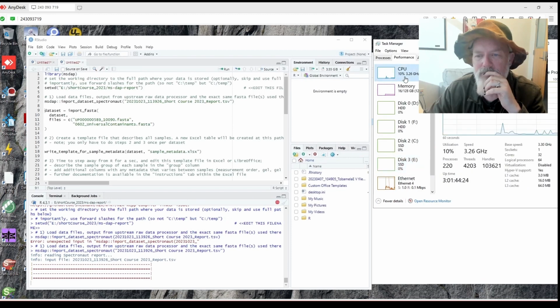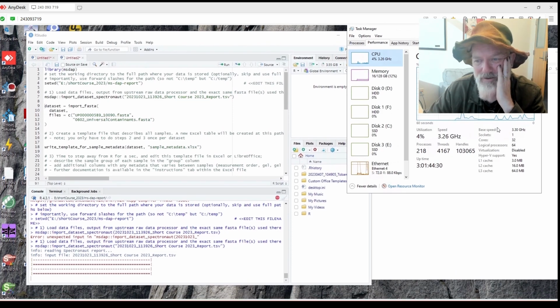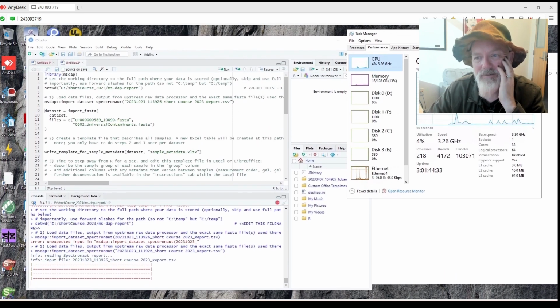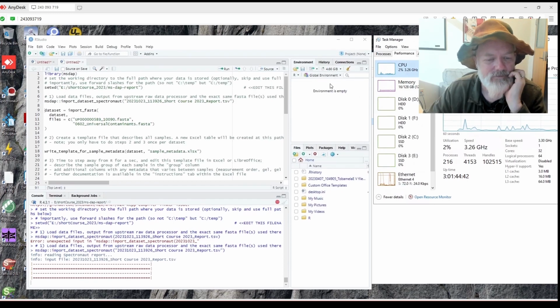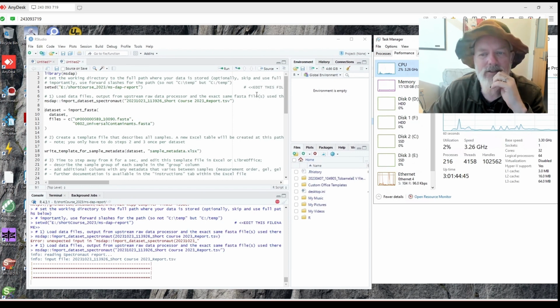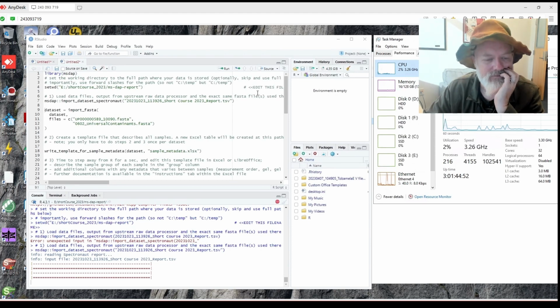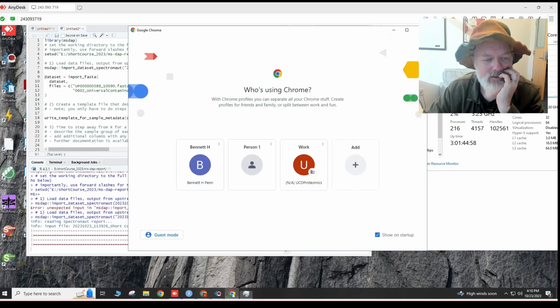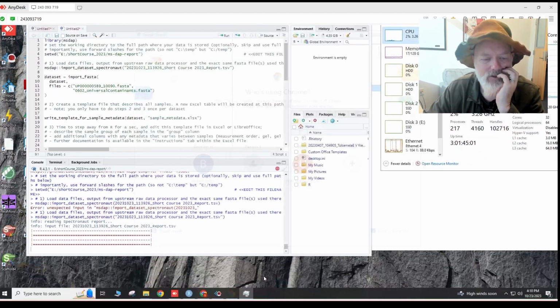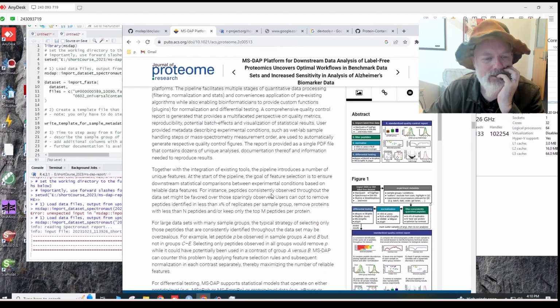Okay. And I'm using a pretty beefy computer, but it's old, so it shouldn't be that much faster than like an i7. It's an older Threadripper with about 128 gigs of memory. So I think if you get an i5 or an i7 with 64 gigs of memory, it should be fine, and probably even faster than this one, I'm imagining. Okay. Let's see. Is it almost done? All right. What else can we do while it's loading? I am going to pause it after a while, though, because it will take a long time to process.